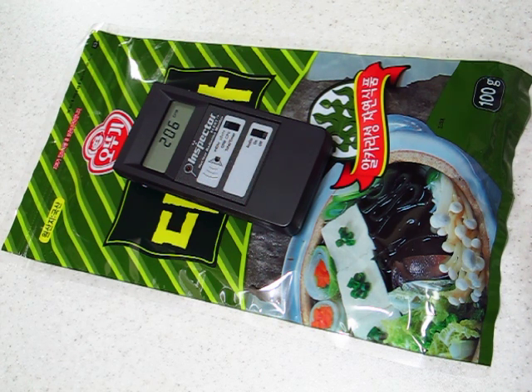Now, I will do a more thorough test a little later on. I'm a little bit short on time these days, so bear with me please. In a moment, I will show you the background radiation level in counts per minute as a comparison for this here.